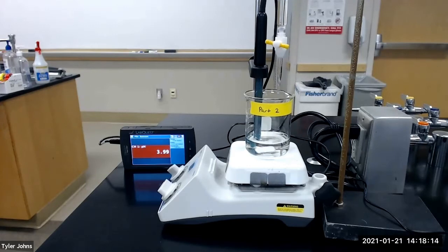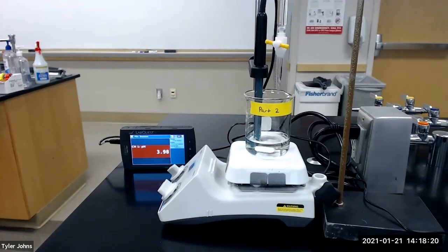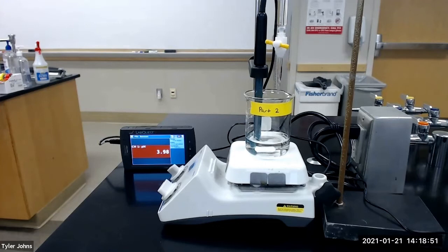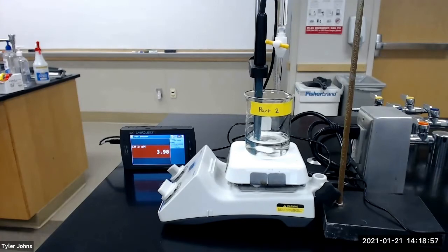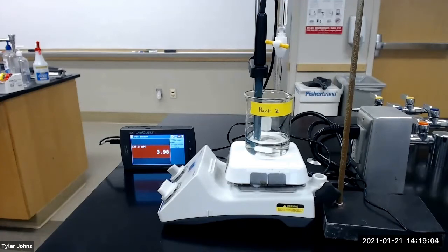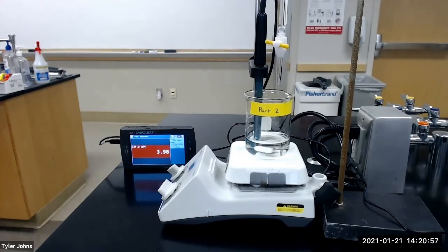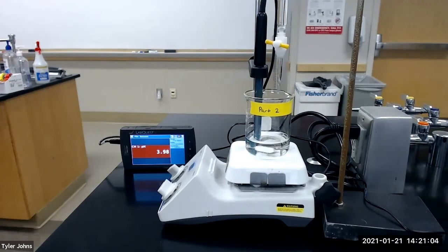The sodium hydroxide solution can be added in one milliliter increments until the pH changes by more than 0.2 to 0.3 pH units. At this point we will reduce the amount of sodium hydroxide standard solution that we add near the equivalence point. After the equivalence point has been passed, the increment of titrant can be readjusted to about one milliliter. We will continue to add the sodium hydroxide solution until the change in pH with each milliliter of base added is approximately what it was at the beginning of the titration. Make sure you record all of the data as you will need to plot the pH versus milliliters of sodium hydroxide titrant added to complete your titration curve.